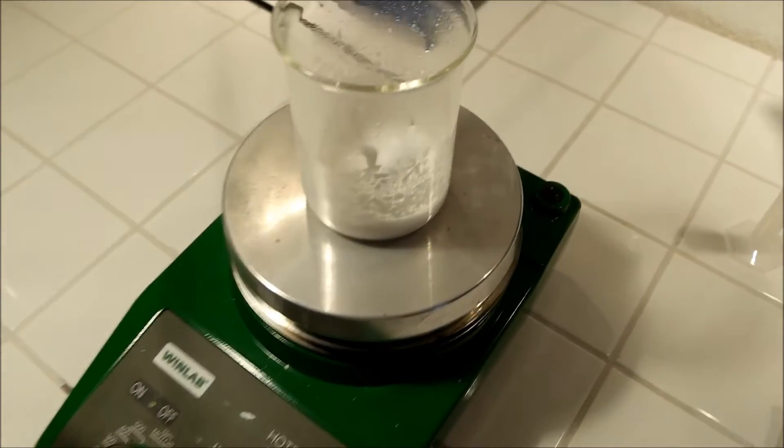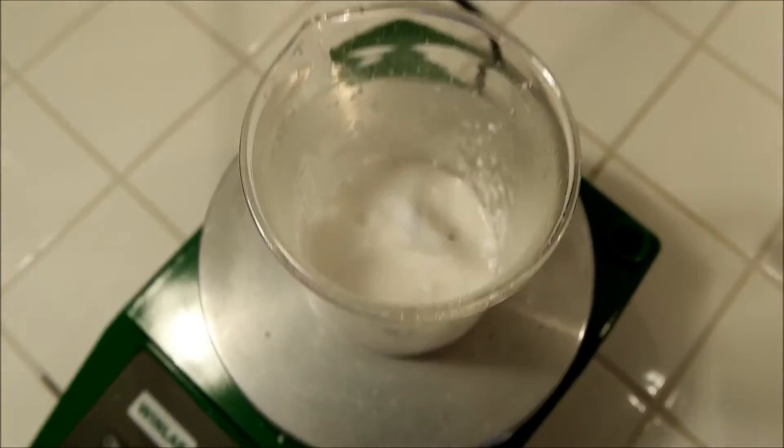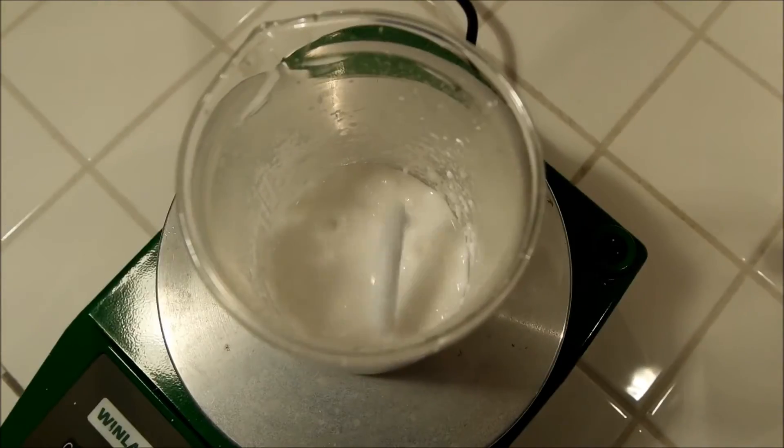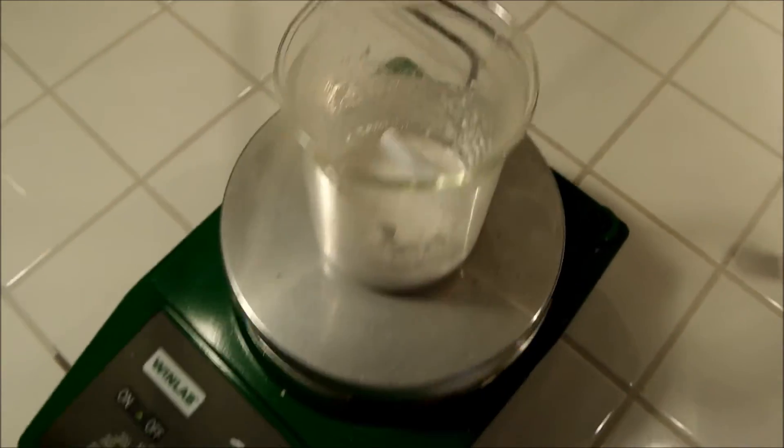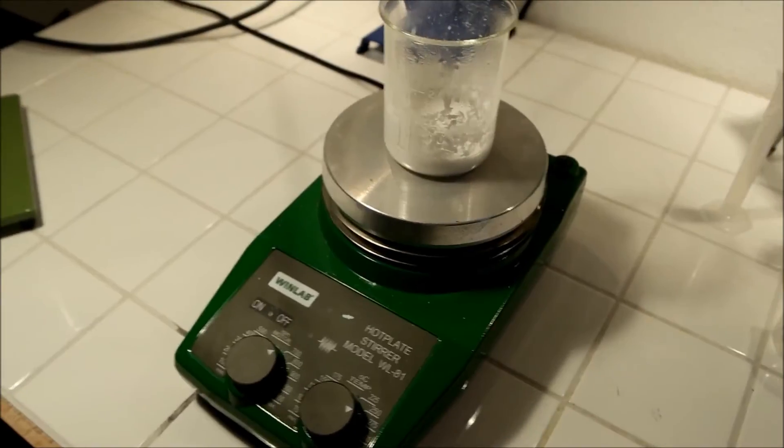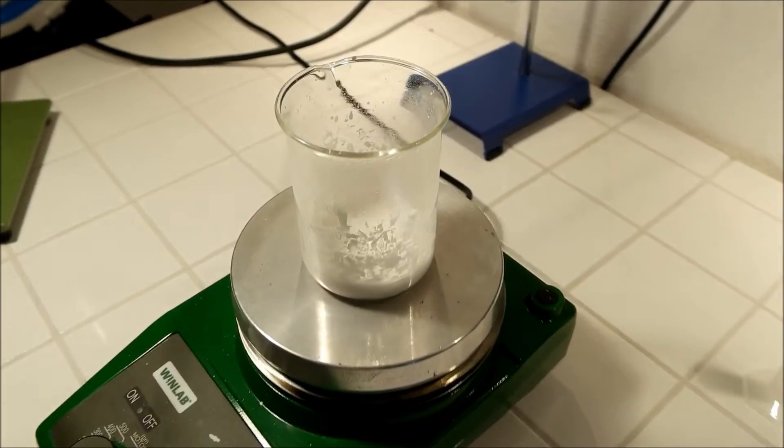When the whole thing looks like this, you're nearly done. So there's not much water still in there. You just have to wait a bit and then it's finished.